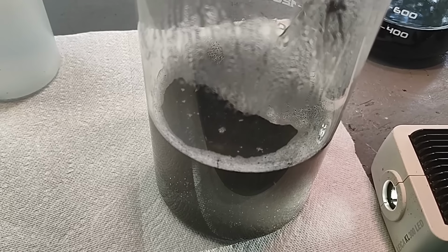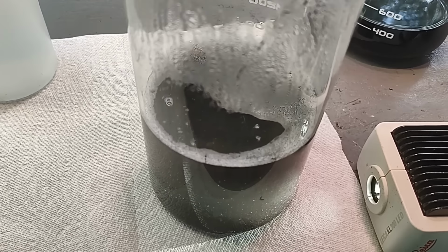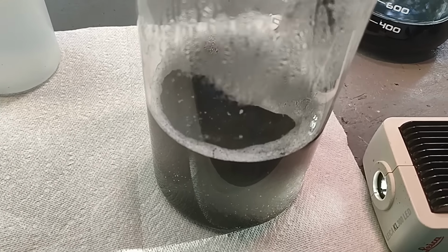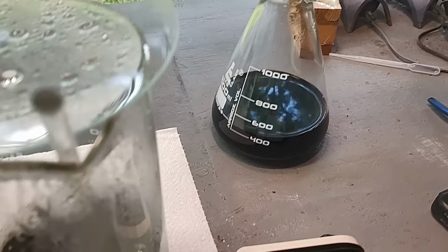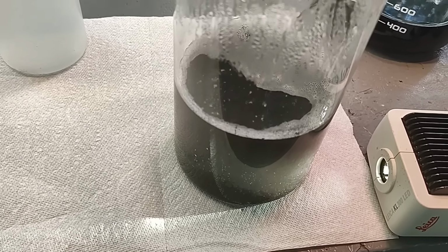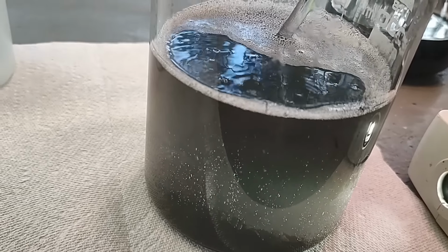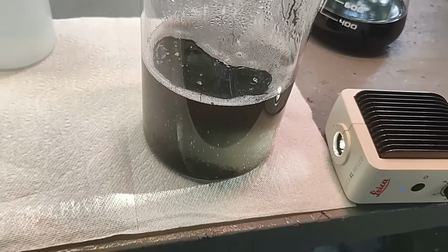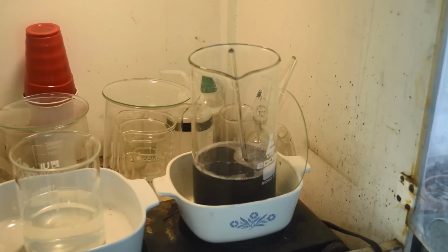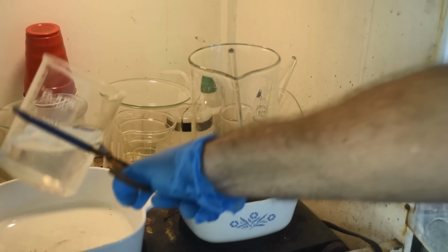So let me put this back on the heat, and I'll add the rest of what I've got to it, and do the second half over here once I get some fresh ammonia. So let me do that. Let me put this back in the fume hood. I've got a feeling this gray color is still palladium in solution, and I just want to get it all. Well, wouldn't it be cool if there's more palladium here than I was thinking there was? So let's try it.